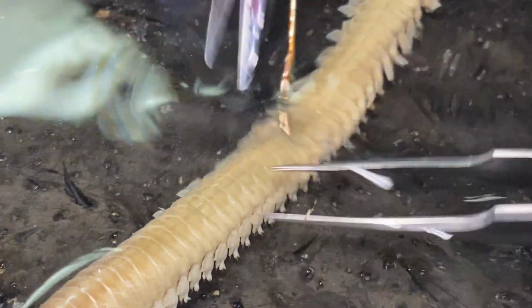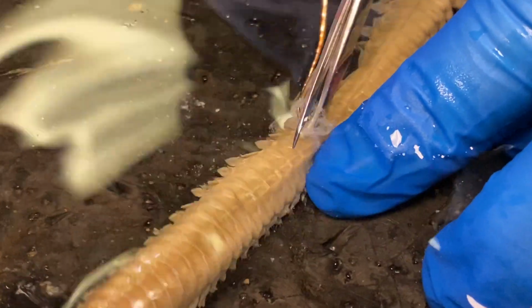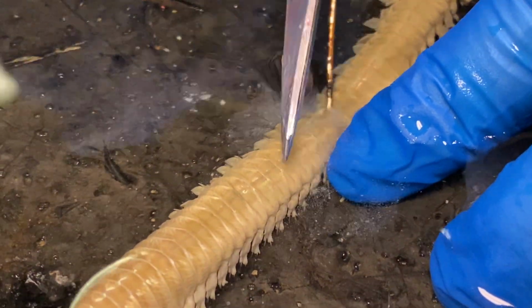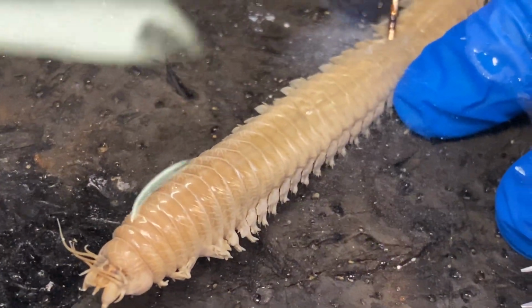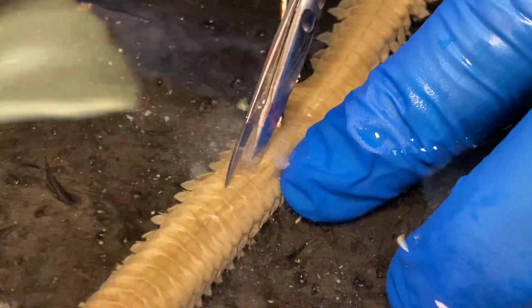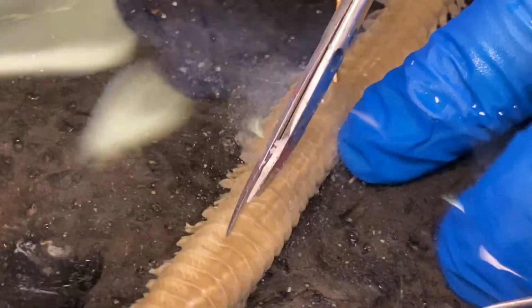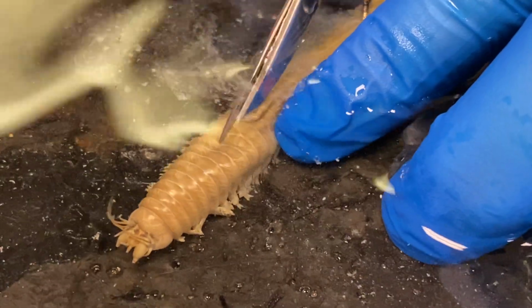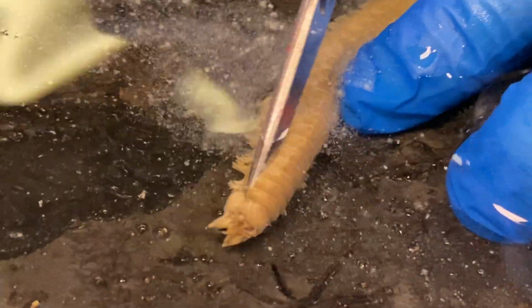with my scissors. From here, I'm going to put my scissors into the worm, pulling up on its back and cutting alongside the worm. Notice I'm going to cut to the right of this median line. This median line is actually the dorsal blood vessel, so I'm going to try my hardest not to puncture that as I cut. And I'm just going to cut all the way up to the top here.